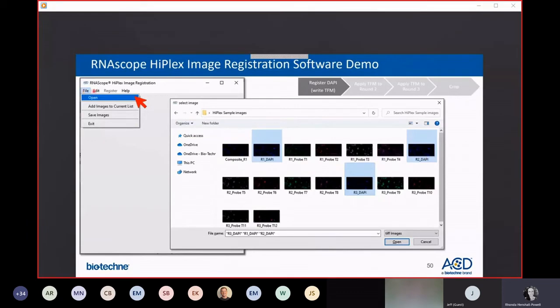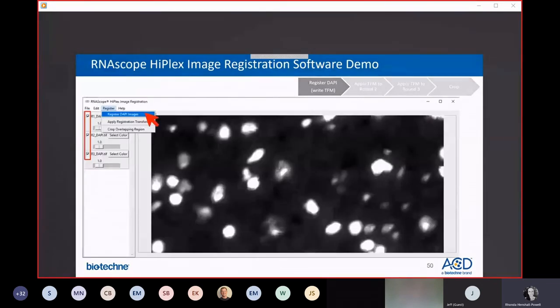So going up to the File menu, click on Open, find the single channel images that correspond with your DAPI staining from each of the rounds of imaging that you did, select them all, and add them to your dashboard.